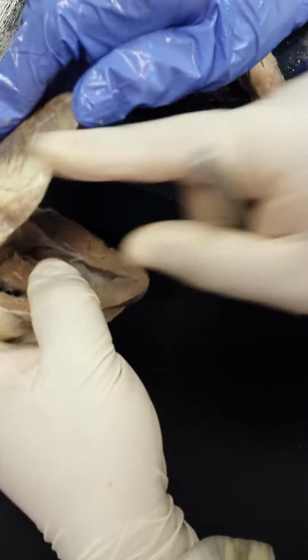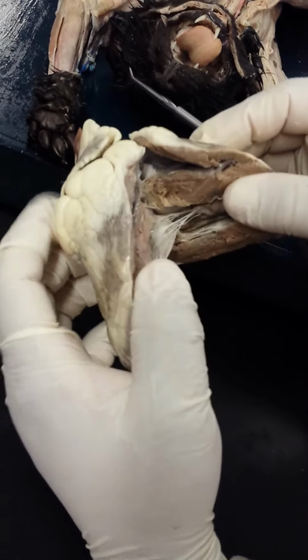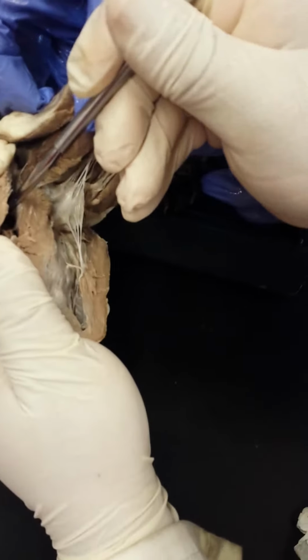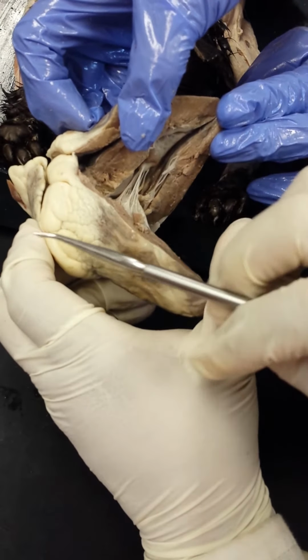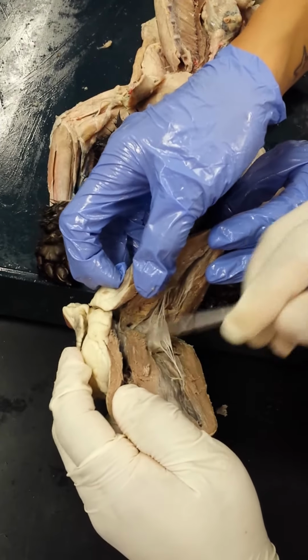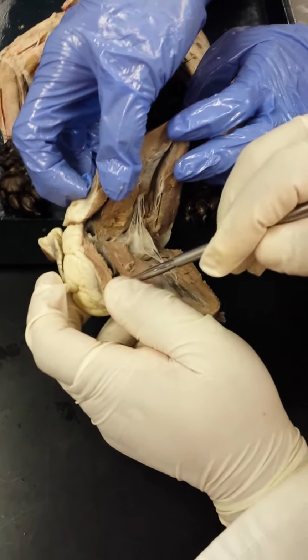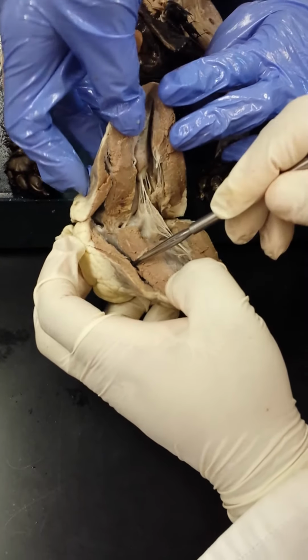As we open this up now, the tricuspid valve is not very visible because it's pretty much back here. There are other hearts where we dissected it more towards the posterior aspect, so you would also see the tricuspid here. Essentially you're just looking for this, but on the right side. So that would be the tricuspid. You would see the chordae tendineae there as well, and the papillary muscles.